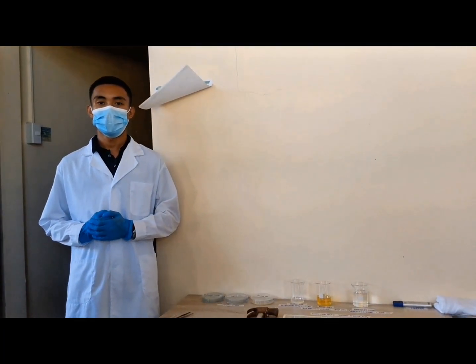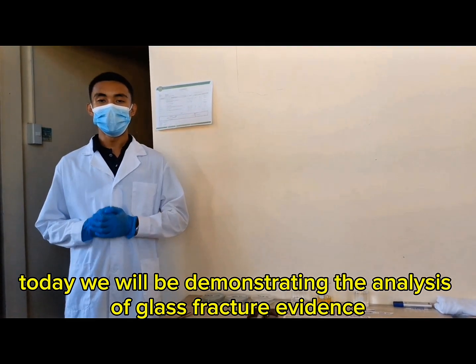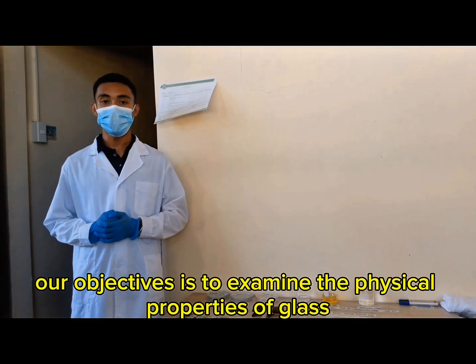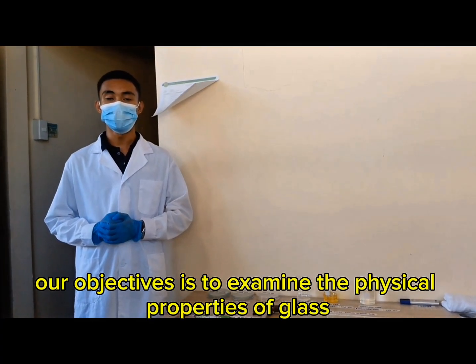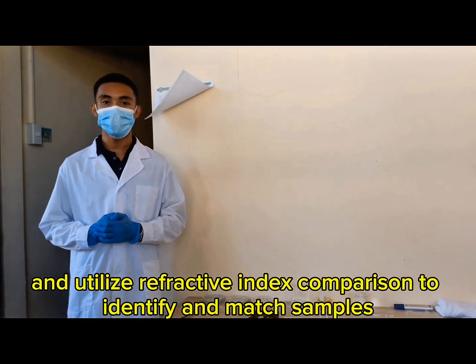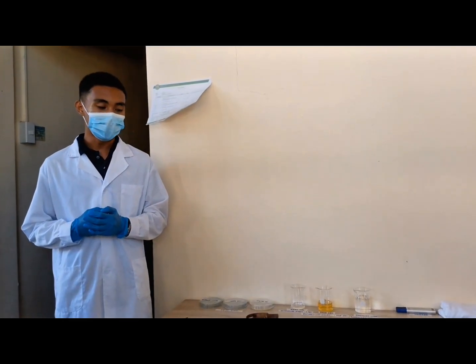Good day. Today, we will be demonstrating the analysis of glass fracture evidence. Our objectives are to examine the physical properties of glass and utilize refractive index comparison to identify and match samples.